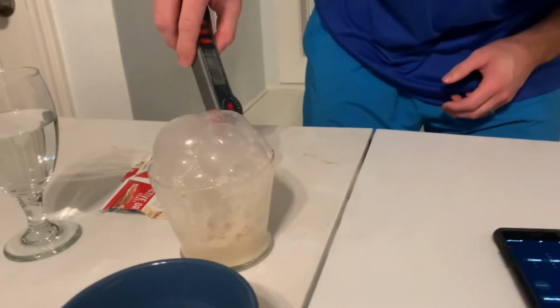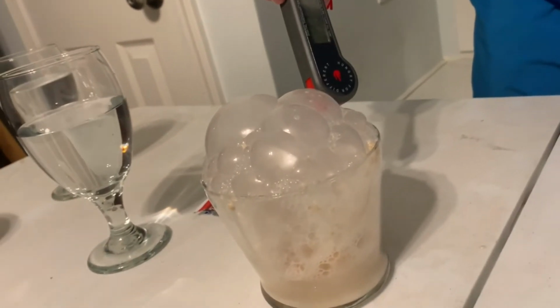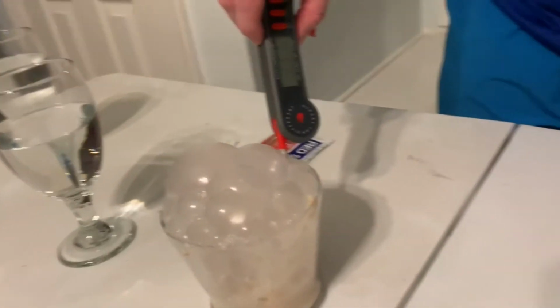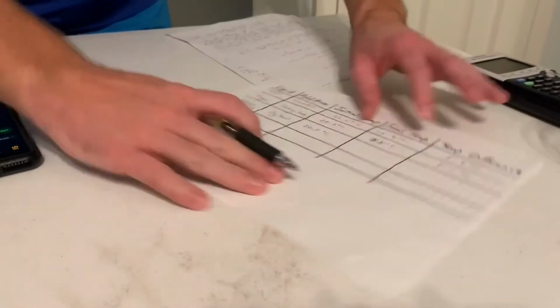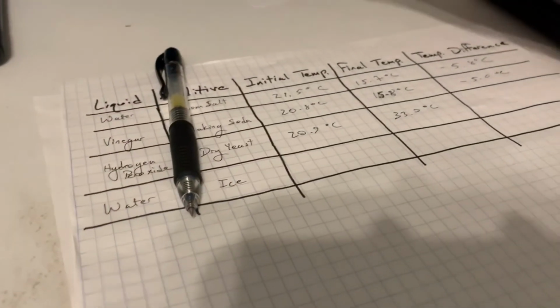Let's check. All right, we've got our thermometer. We're going to put it in here. Let's see what we're reading at. Oh, wow. We are at 33.0 degrees Celsius. All right, write that down. 33.0 degrees Celsius.